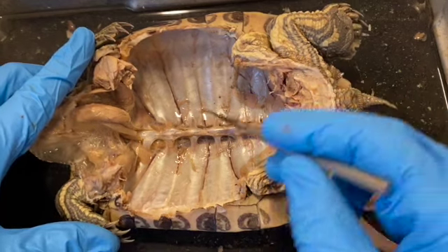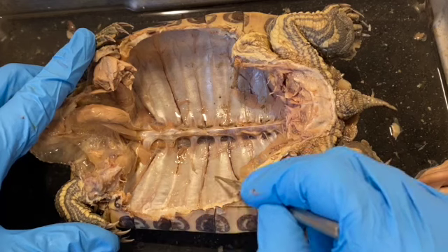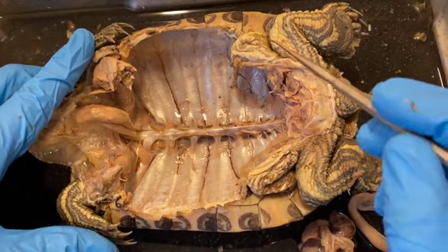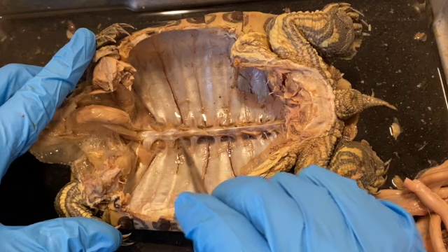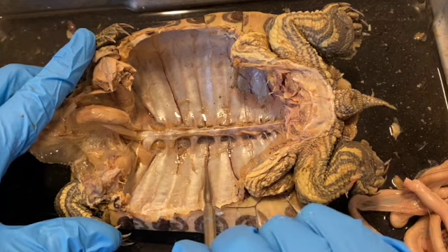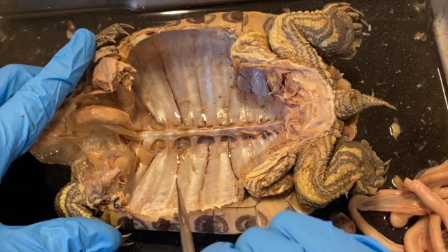So if you notice right here, these bones are actually the ribs, and they're fused together to make the carapace of the shell. And the connections here are fused vertebrae, giving it a very rigid structure, and then the connections to the ribs coming off.